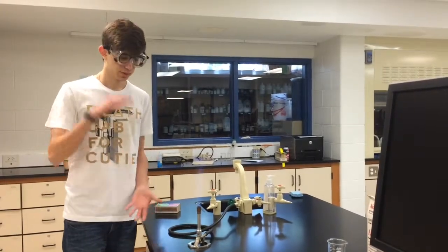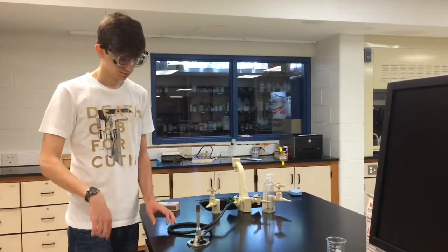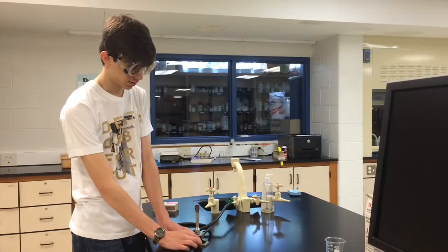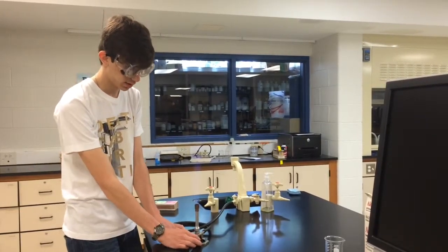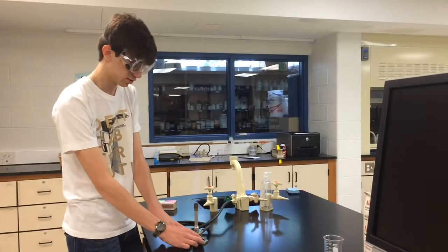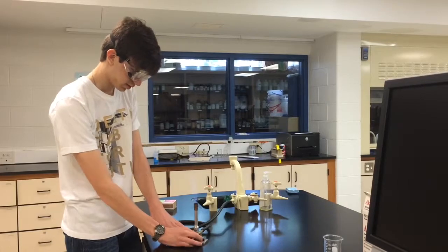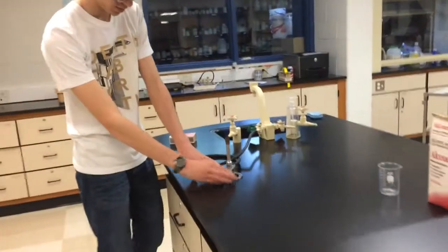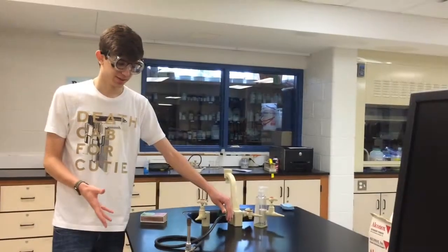Now this is also a really big flame, and you don't need it huge and very tall. To turn that down, you're also going to want to turn this little knob underneath it. You'll see it. It's really easy to see. You're just going to want to turn that clockwise, or counterclockwise. That'll bring the flame down to an acceptable level. So it's just a nice small blue. You're done with your Bunsen burner flame.